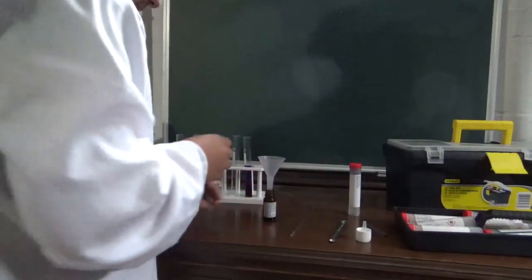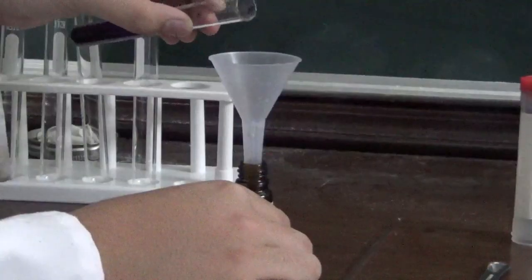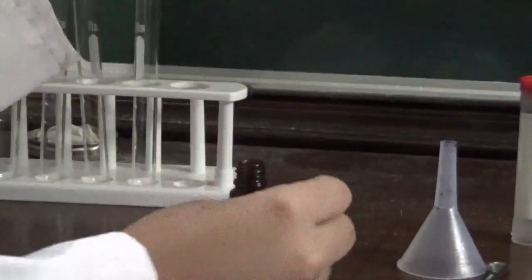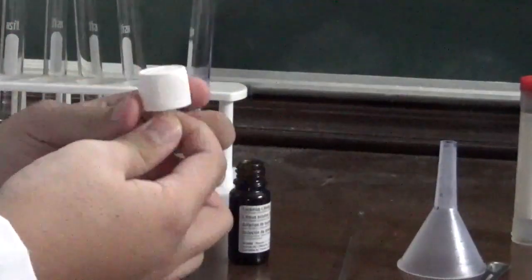So now the next step is to put it into this bottle here, which is going to store our litmus solution. Add this funnel, and we're going to put the solution into there just like so. Oh wow, that thing's full.